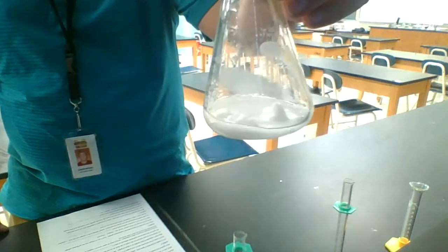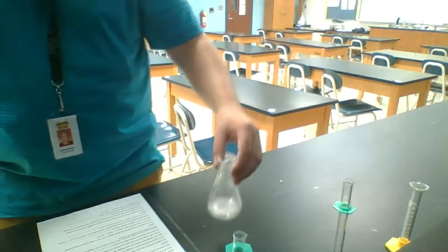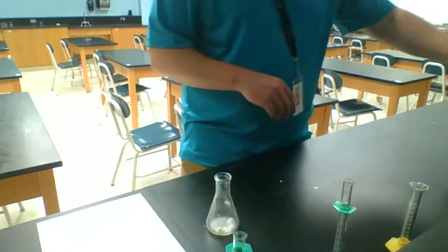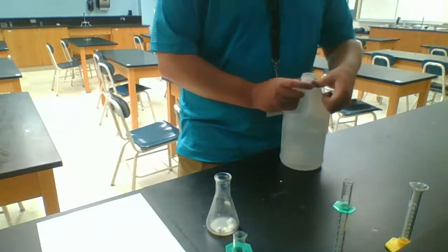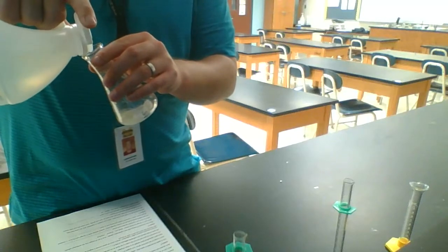I don't know how much you can see with the video quality, but as you are watching it, you might be able to hear it as well. It's almost fizzing. And we had an effect happen. Let's go ahead and just add some more. I just have a lot of baking soda left over.